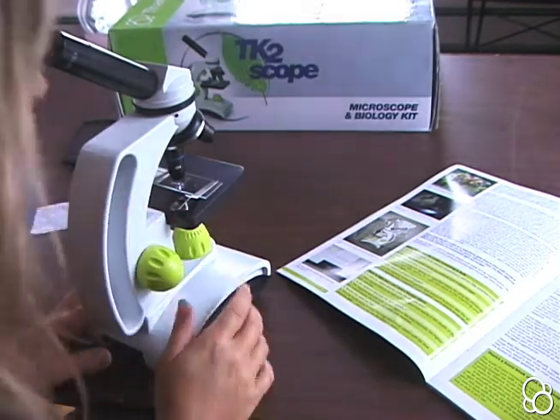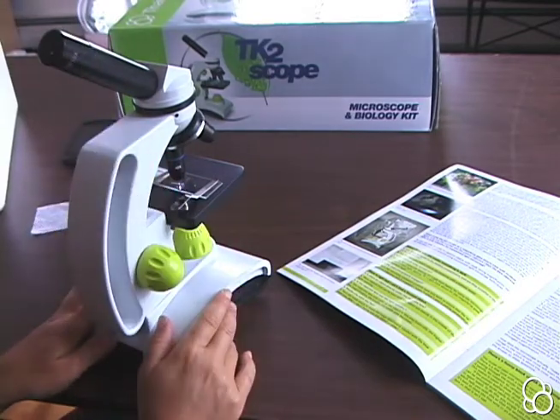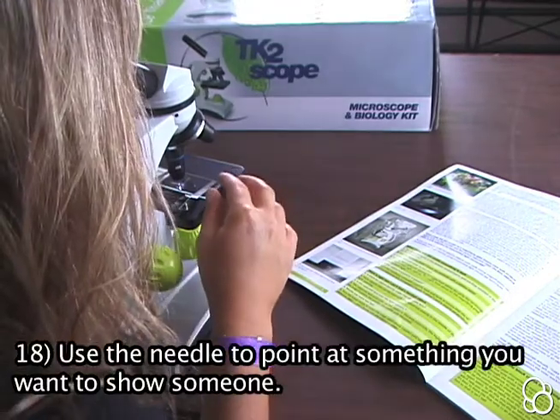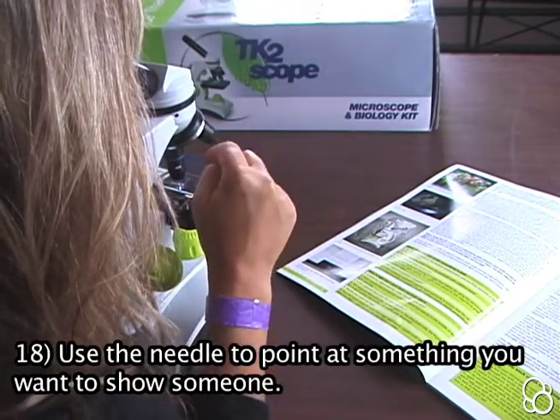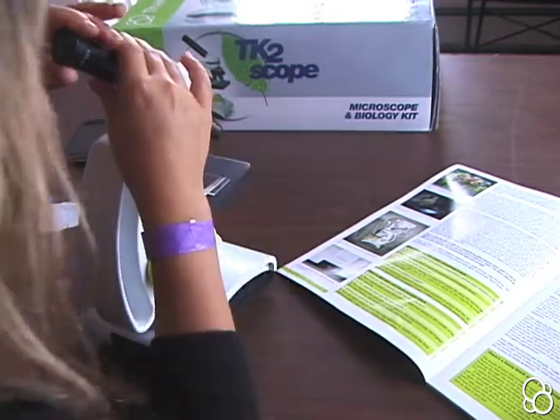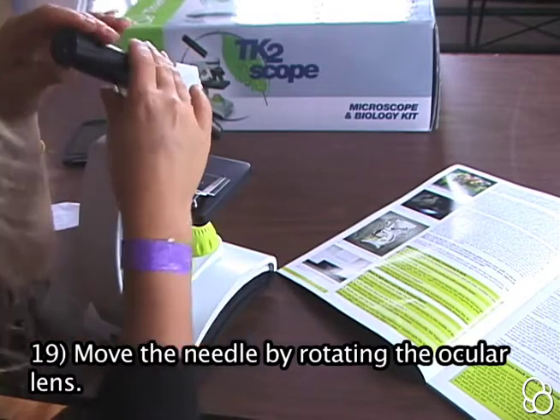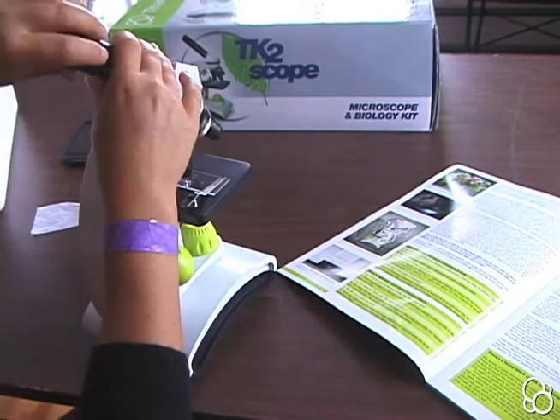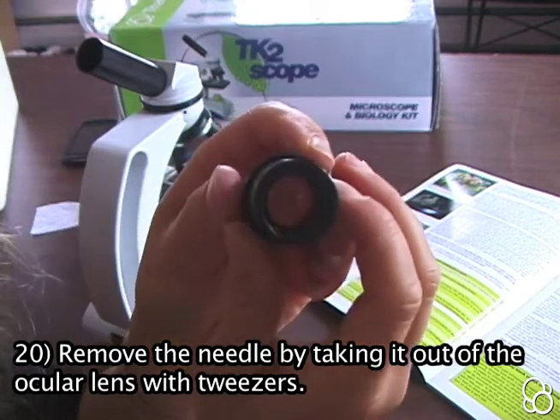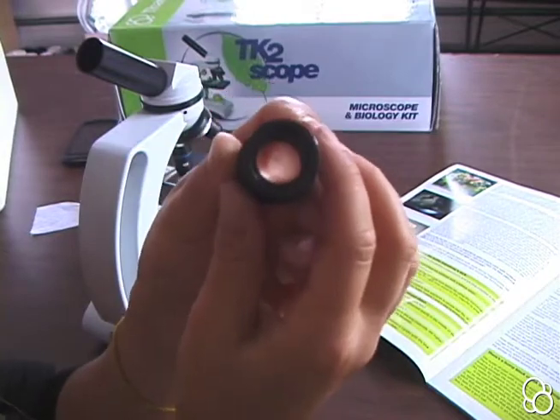You should also see a black needle in your view, which is a piece of wire in the ocular lens that's useful for showing things to people. You can line up a slide so that something interesting is right at the pointer and then pass the microscope to someone so they can look at it. You can move the needle around by rotating the ocular lens, and if you ever decide you don't want the needle in there, you can look inside, pull the wire out with tweezers, and put it back when you want it.